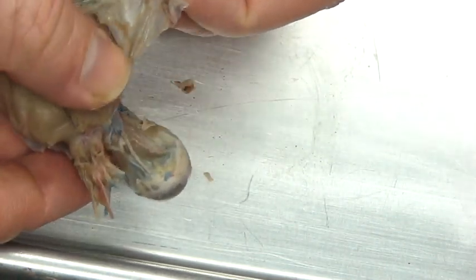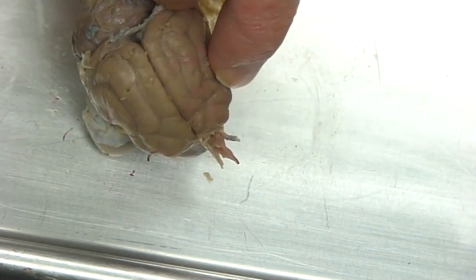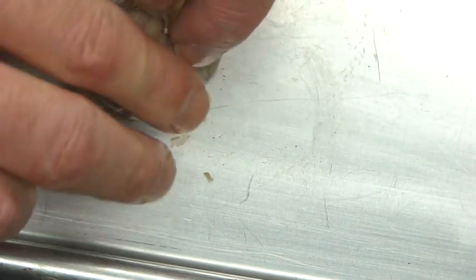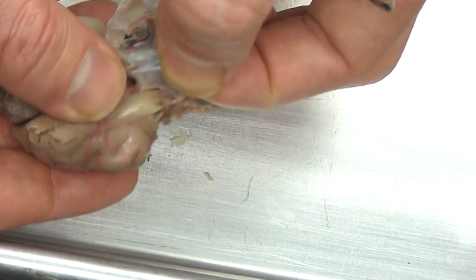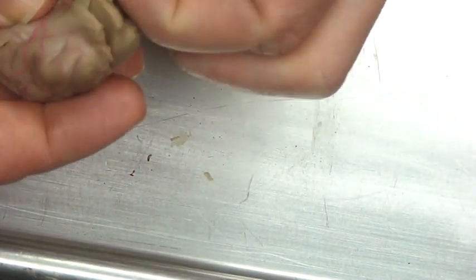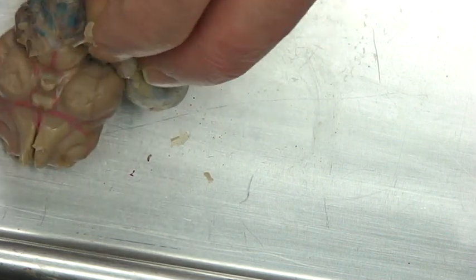Most often the dura mater will peel off right with the skull as students are removing it. Now we get down to the cerebellum — we're also going to see it's compartmentalized, so you need to be careful otherwise you'll pull the brain apart. It's very soft tissue, very easy to damage. It'll actually wrap around and come off in one sheet. Most often what happens is the olfactory lobes will come off with it — and I fully expect that to happen. This is the view that most students will have. The optic nerves will also start coming off with it, so you can see all of these structures are being protected by the dura mater.